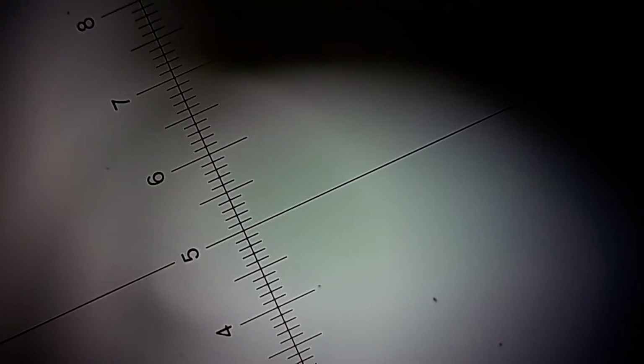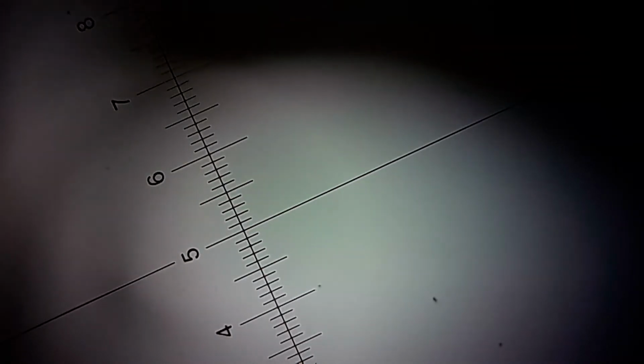Microscopic size, scale. Let's increase the light first so we can see whether we hit the eyepiece or not. That's why you have to turn it on. The eyepiece that I'm using has a ruler inside it, on the lens of the eyepiece. So let's focus it and increase the zoom from the phone. We're going to search for the banana peel piece.